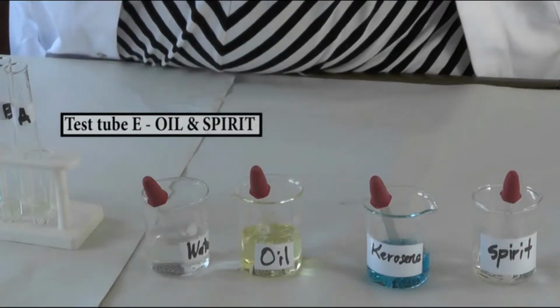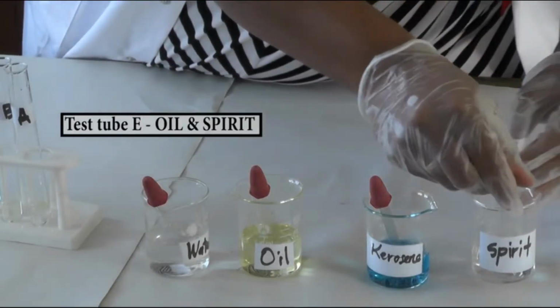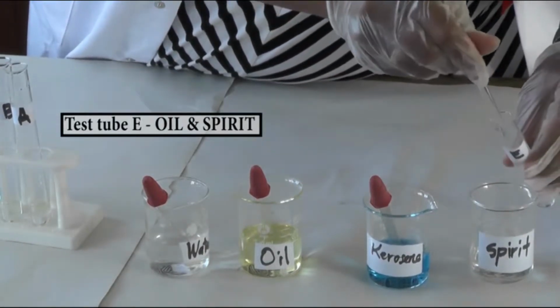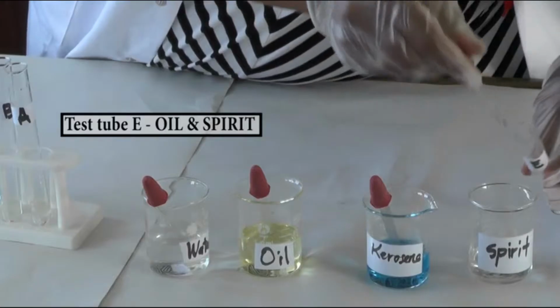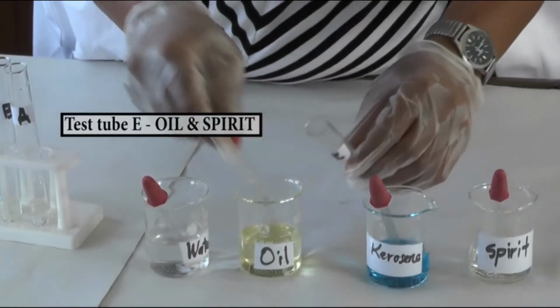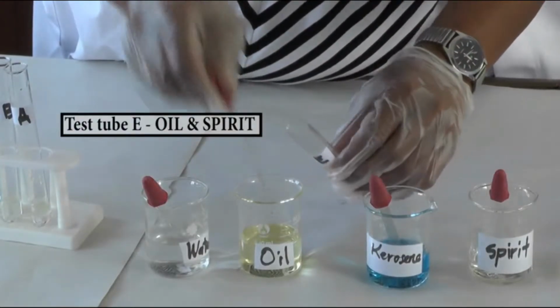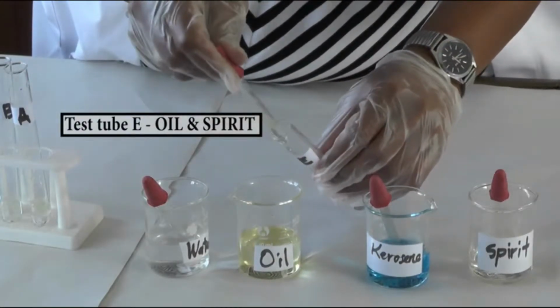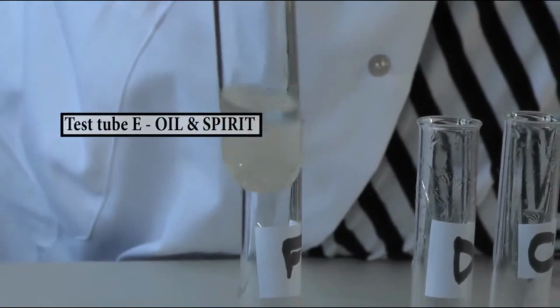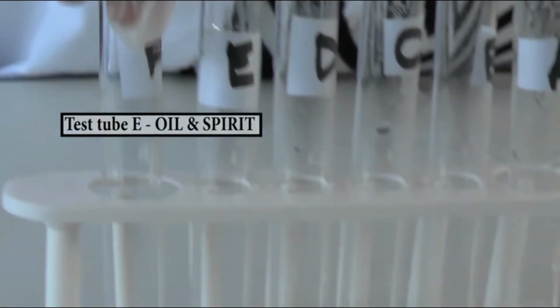For test tube E, mix methylated spirit and oil. After mixing, put the test tube back on the test tube rack.